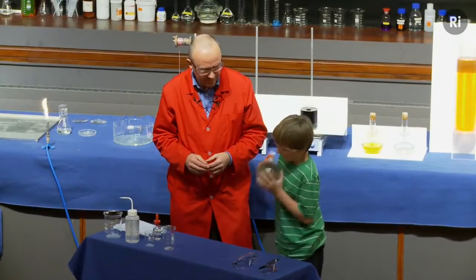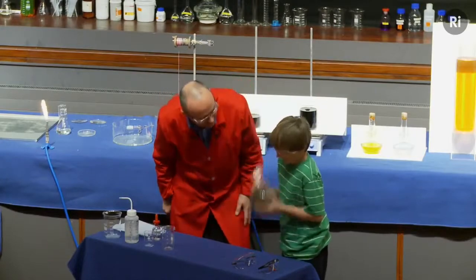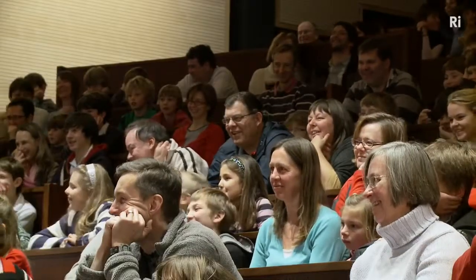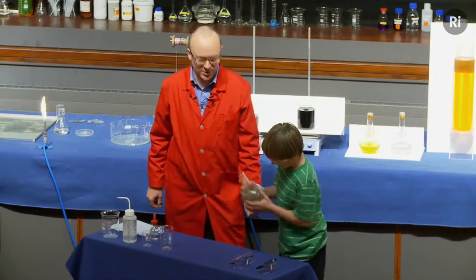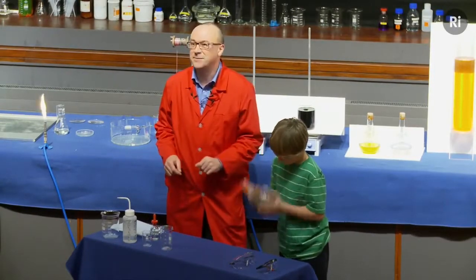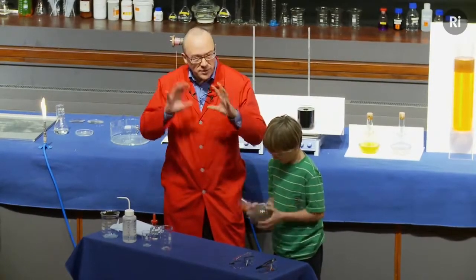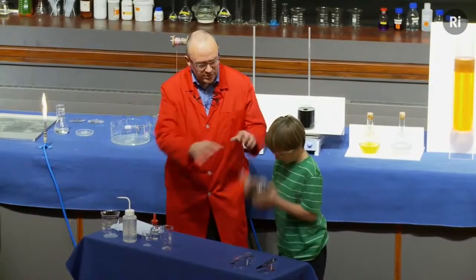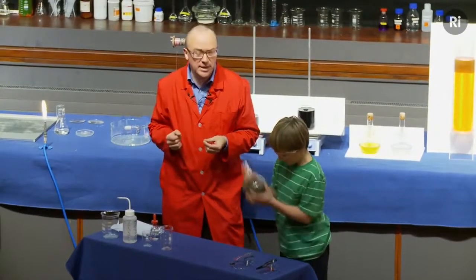Keep shaking. It takes about 3/4 of an hour, is that okay? It does actually take a minute or two, but the harder you shake, the better it works, so keep shaking. Don't drop it though. So silver metal is being formed sort of atom by atom, and you can see it's all going quite black. That's because very finely divided silver is actually black in colour.